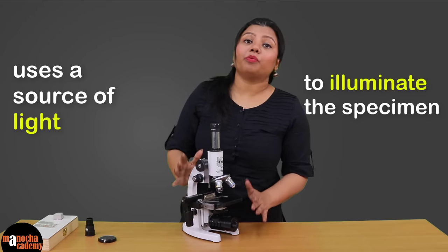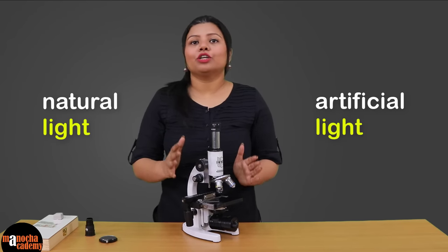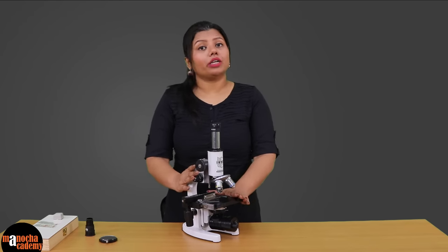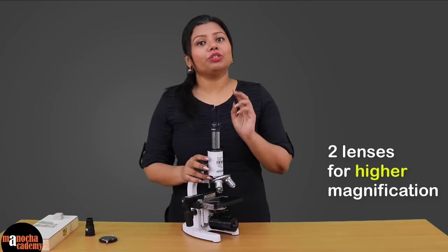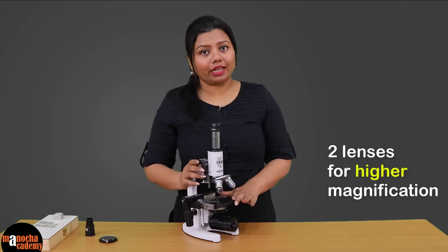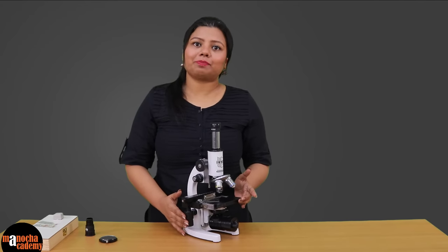In this microscope we will use LED light. However, you can also use natural or artificial light to illuminate the specimen. It is known as a compound microscope because in this microscope we use two different lenses with different magnifications so that your final image has a much larger magnification. Let us see what are the different parts and how they help in observing specimens.